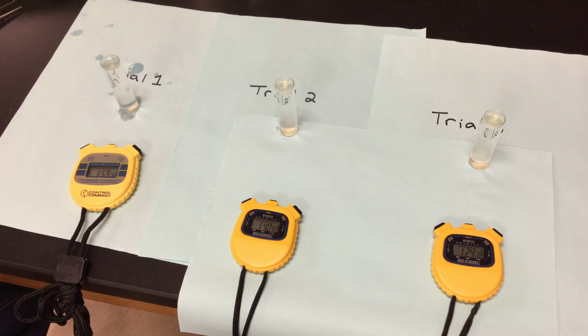When you are making those graphs, at this point it should be done on the computer. If you're not sure how to do it, contact me. We can go through it. If you need a little Google lesson on it, or a YouTube video that might teach you how to do that, please do so. But what you're graphing are going to be the averages for each one of these pHs.